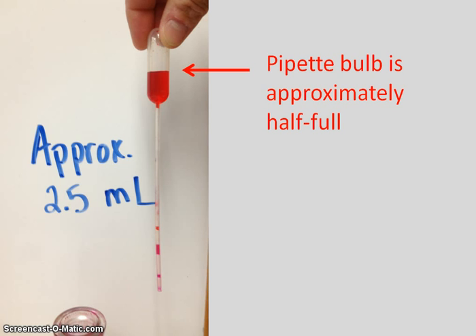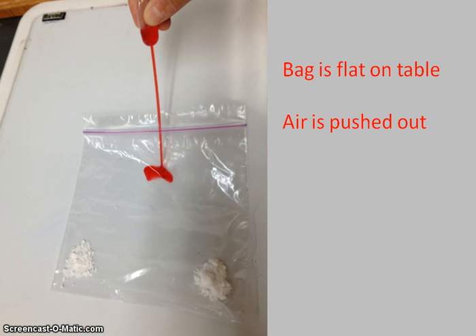You will have measuring spoons to measure the quantities of calcium chloride and sodium bicarbonate. But because 2.5 milliliters is such a small volume, we're going to estimate that volume by only filling the pipette bulb about half full of phenol red, like you see in this picture here.